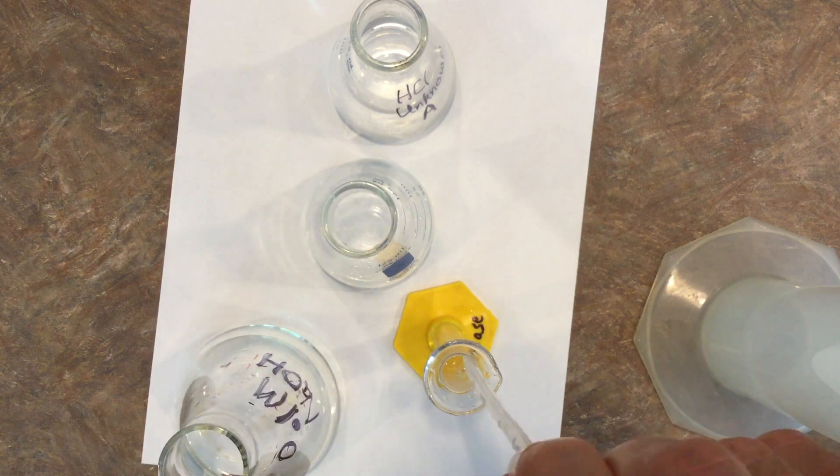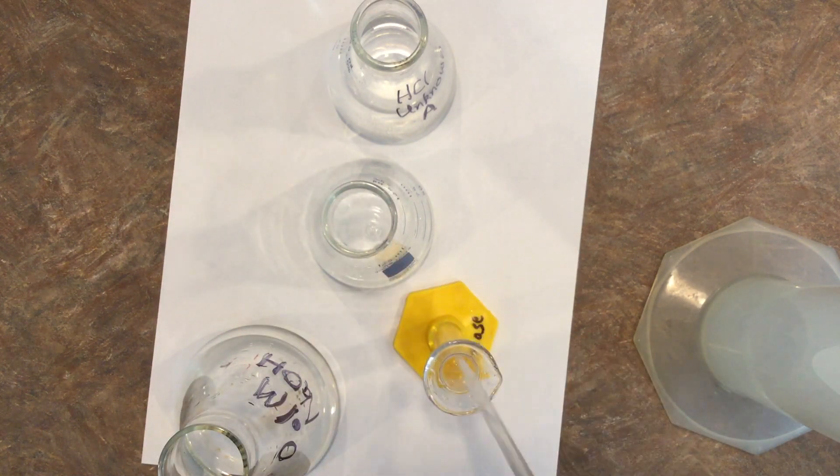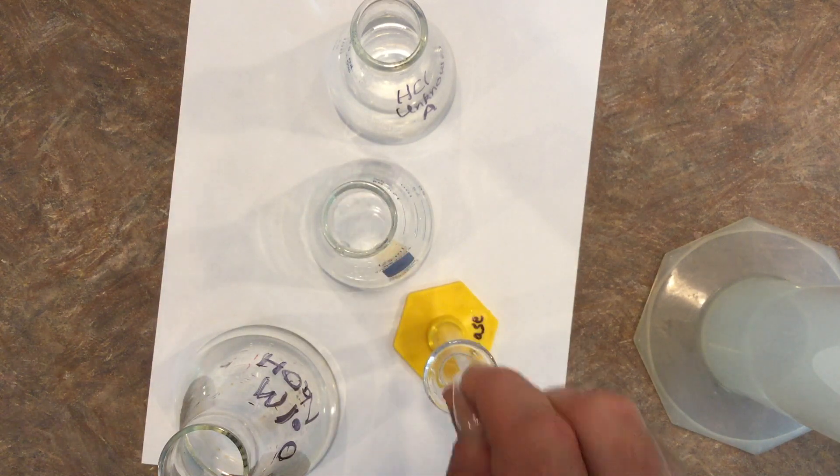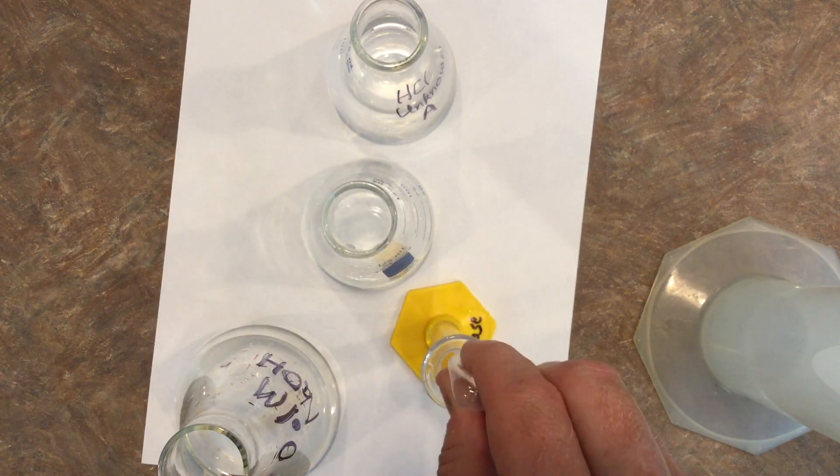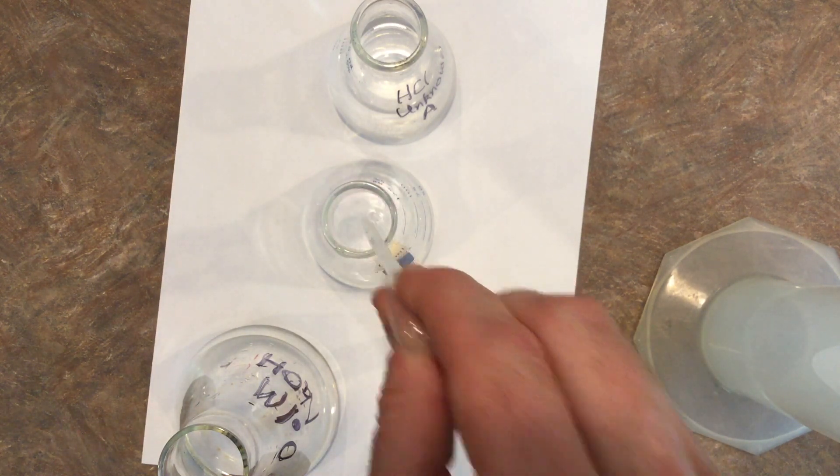I've used 10 milliliters. I need to fill it up again. As the sodium hydroxide hits the hydrochloric acid solution, sometimes you're seeing that pink color. In those small areas, NaOH is winning. The base is winning. But as I swirl it around, you can see that overall the acid's winning and it goes back to the clear color.